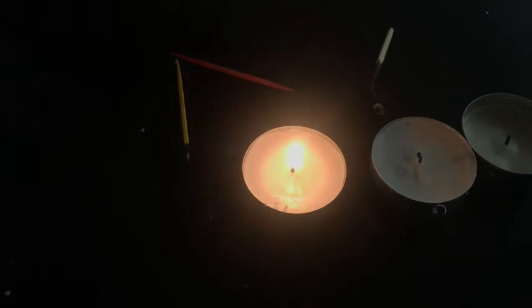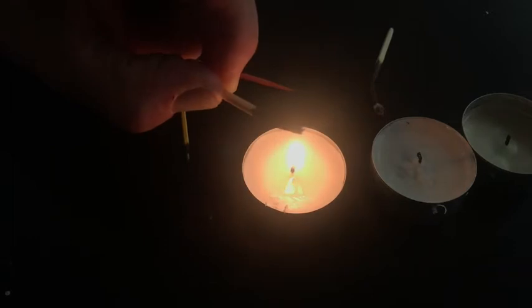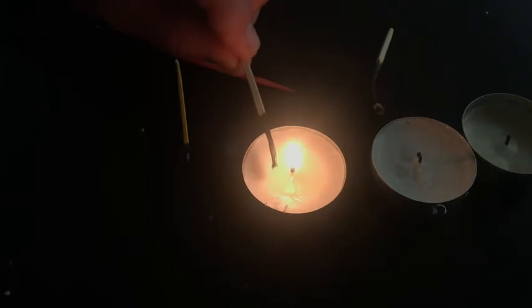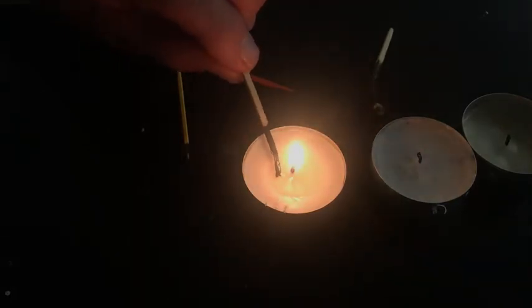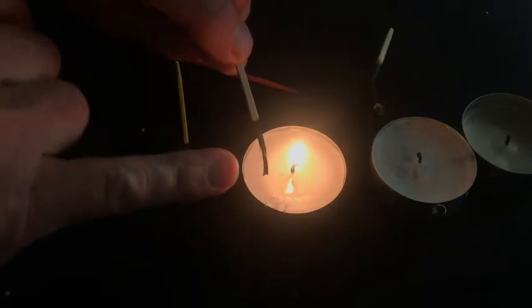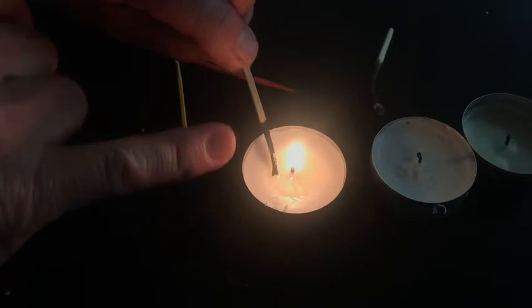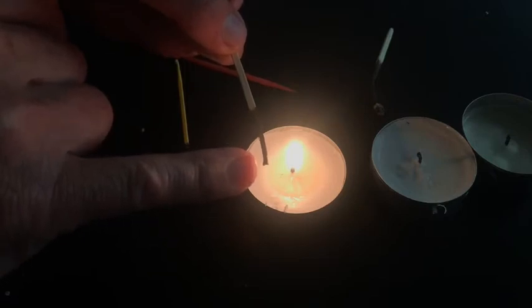Okay, so for the next experiment, we're going to use our matchstick that was burned, but also it's enough so I can hang on to it and see. And so what we're going to do is see what the properties of the wick are. So essentially, this is how the wick is acting. I put the wax in here, and you can see that what's happening is, well, you can't see, but it's actually getting wet from here all the way up to here.